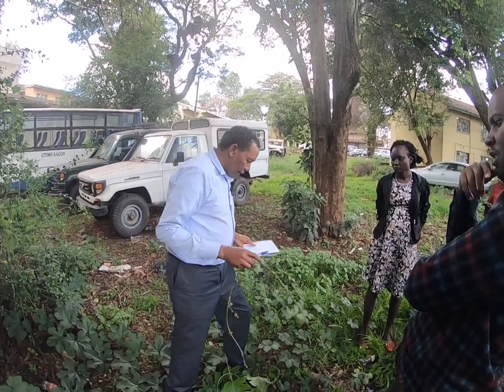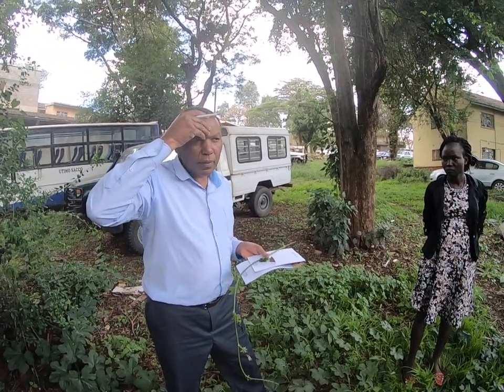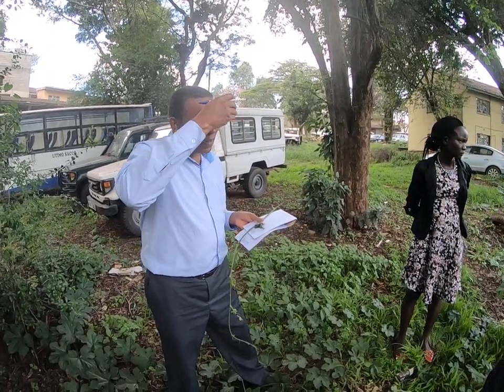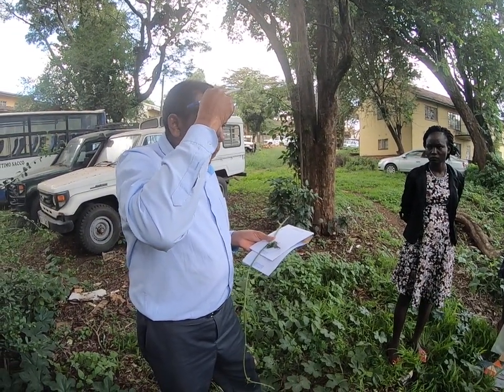So let's press and see. What if it has a fruit? Maybe the one which is not edible. If it's not edible? Yeah, the fruit. I'm assuming now your mission is to look for edible stuff, right? Oh, yeah. Edible stuff. But what if the leaves are edible but the fruit isn't? The purpose of collecting this is purely for identification. You are not collecting a sample of the fruit for eating. You are collecting it for identification.